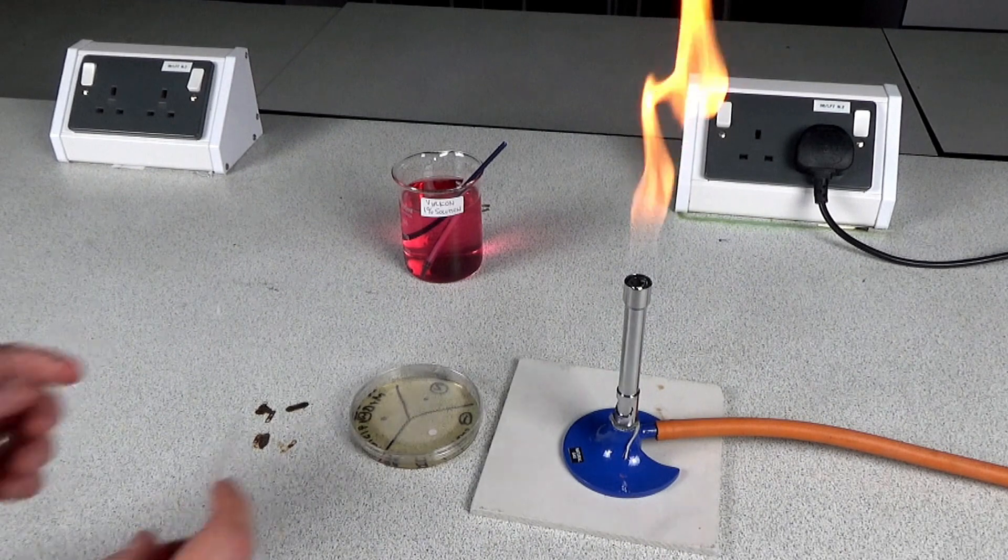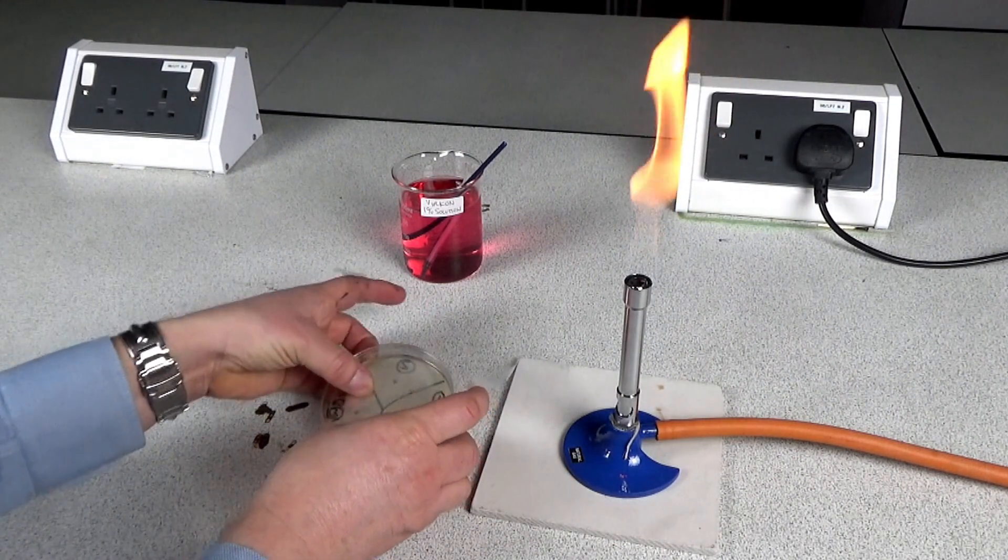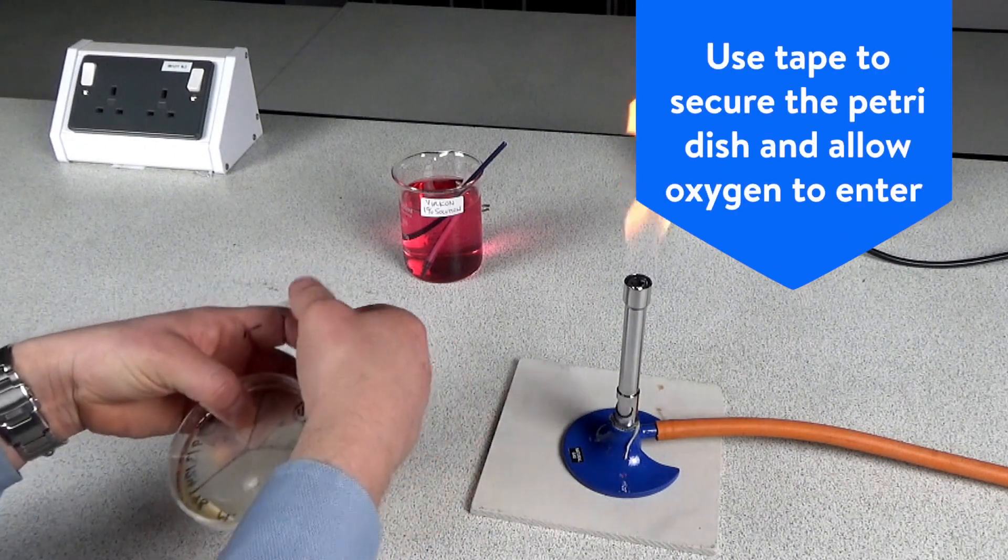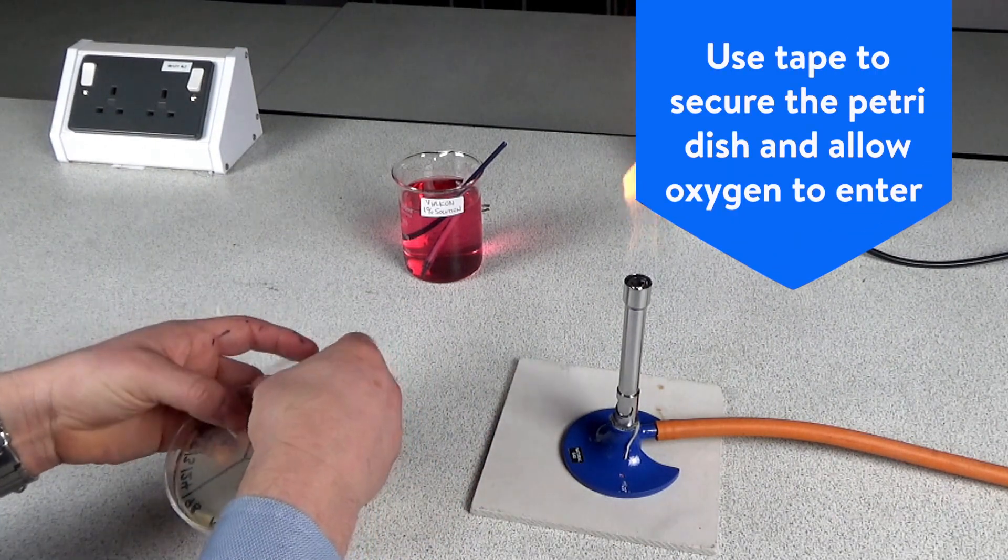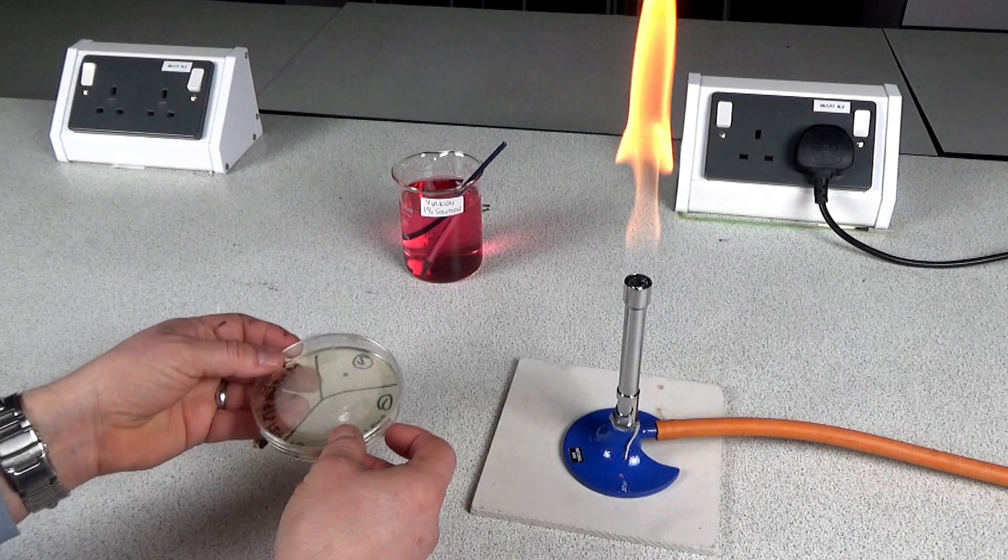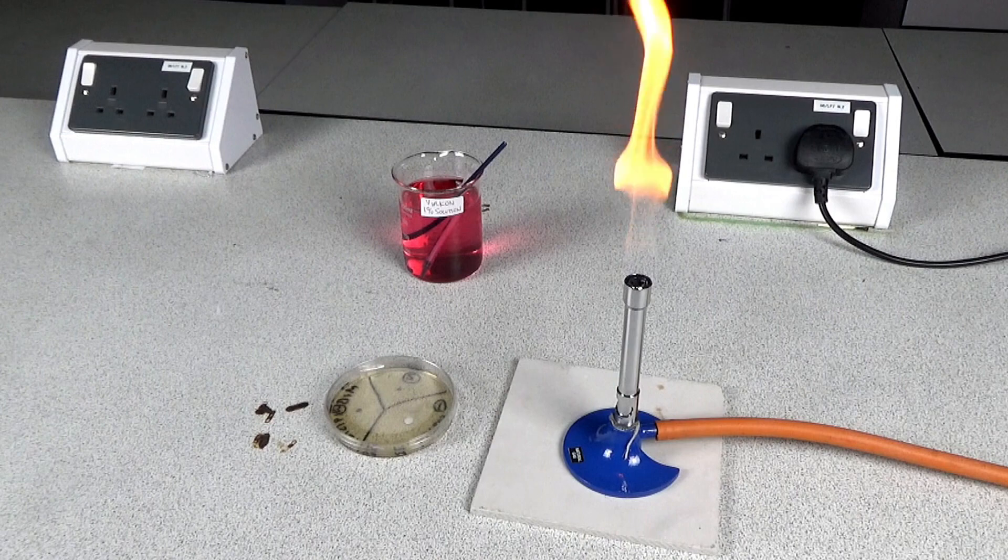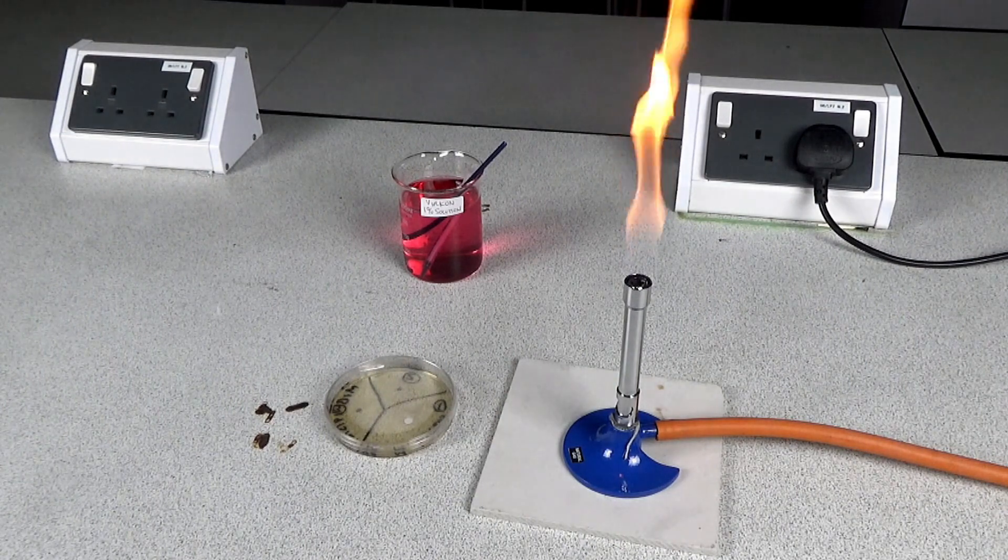Your students then use two pieces of sticky tape to secure the lid of the petri dish, put one on each side. It's very important we do it this way so that it can allow oxygen into the dish. We don't want to create anaerobic conditions because that's more likely to encourage the growth of pathogenic bacteria.